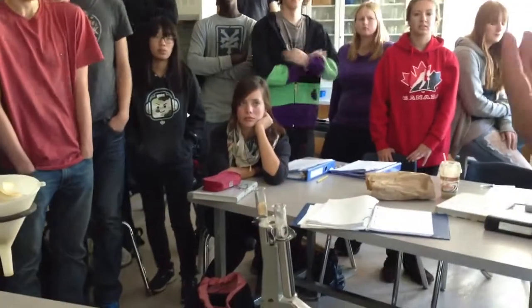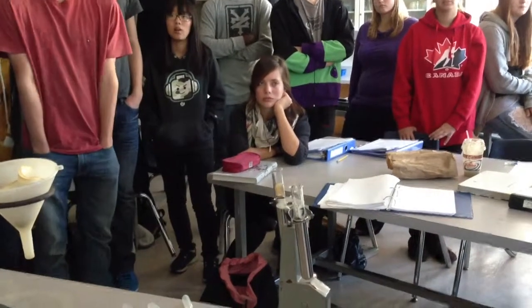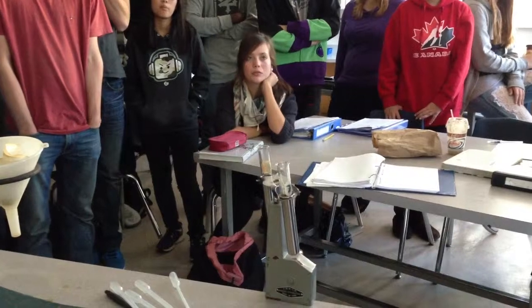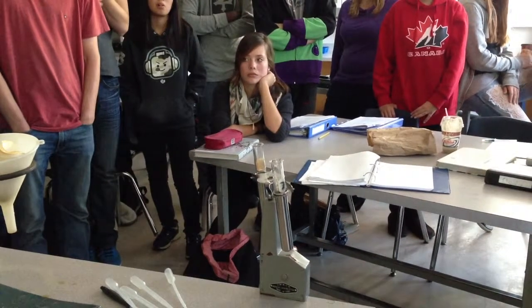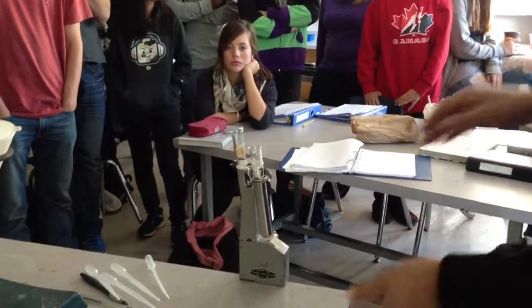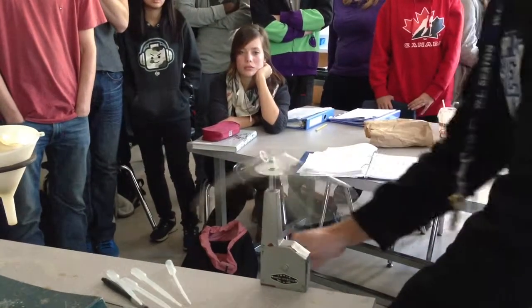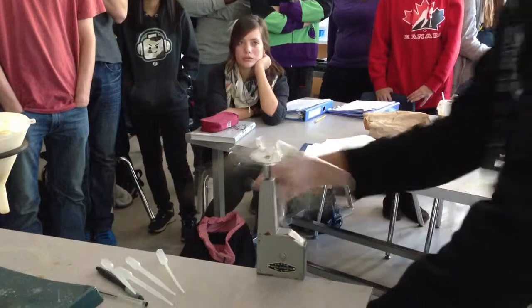And as this is spinning, it's as if you've got like Jupiter gravity or something like that. Okay, so the force felt in there is going to be many times stronger than gravity, and that's going to make the dense things slide down more quickly than they would have otherwise. This is heavily geared, so small turns at the bottom equal high speed up top.